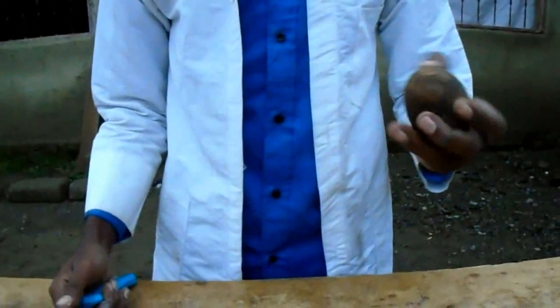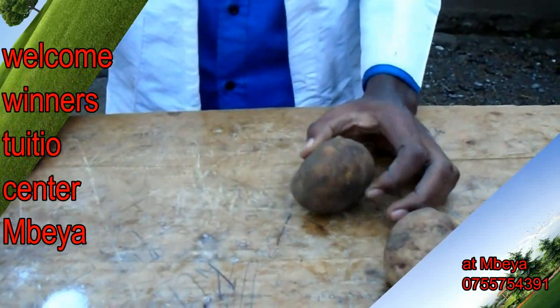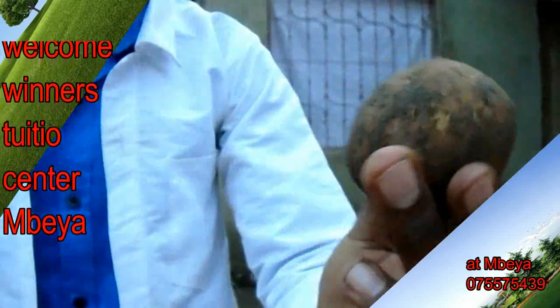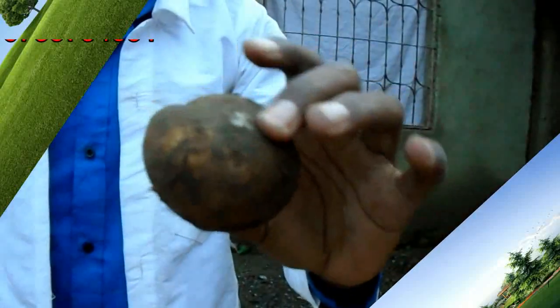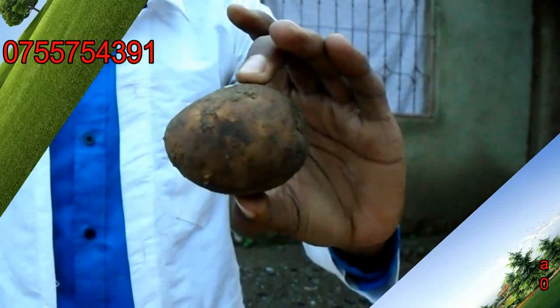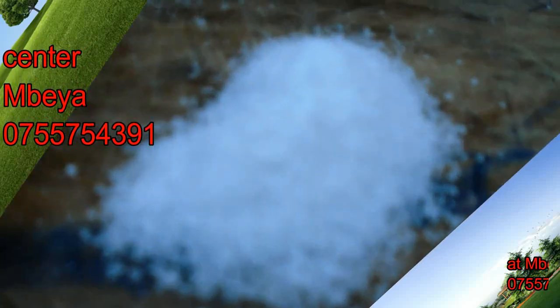Before continuing, let me mention the materials I have here so that you can be familiar with what I'm going to demonstrate today. I have an Irish potato — this is a fresh Irish potato. It has a lot of water, and it also has a semi-permeable membrane which allows material to pass through from the region of low concentration of salt to the region of higher concentration of salt. I also have solute concentration, particularly known as salt.